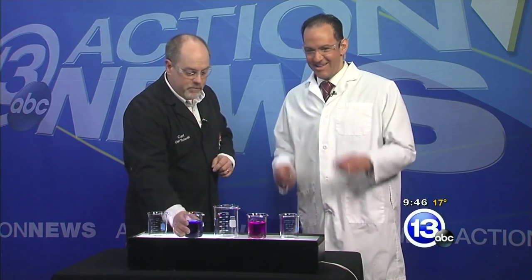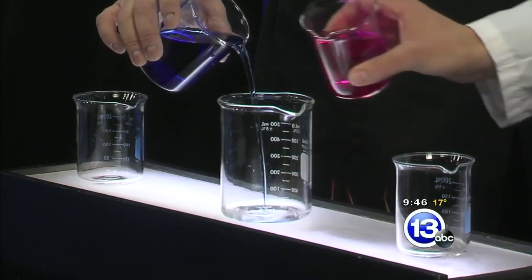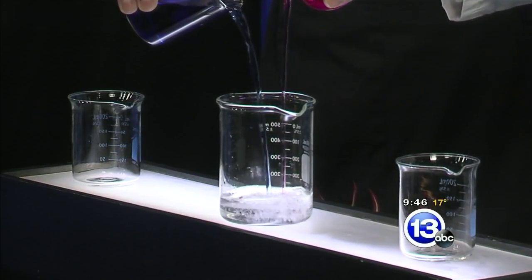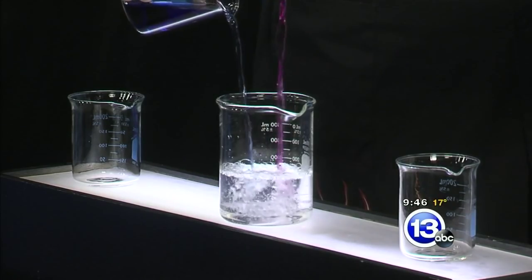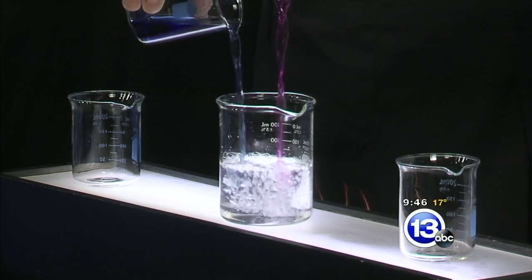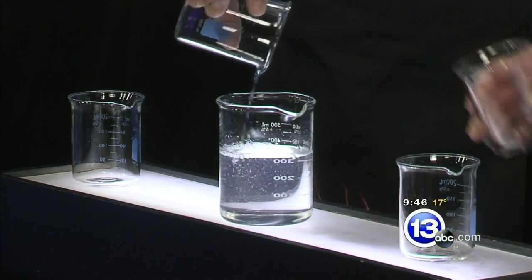The cool thing is we can switch it back — it doesn't have to stay that color. In this big beaker I've added some hydrochloric acid. So if we pour the colored liquids back in — you can pour yours in as well — both colors go in but they change back to clear, indicating we've moved away from being an alkaline or basic solution.